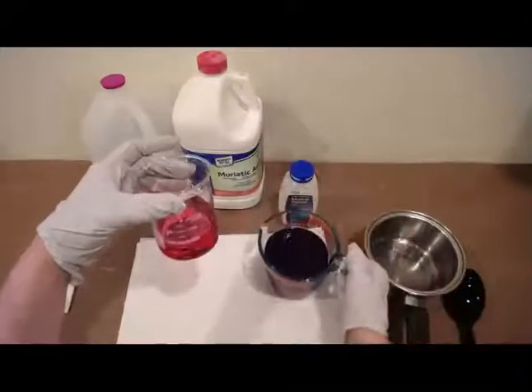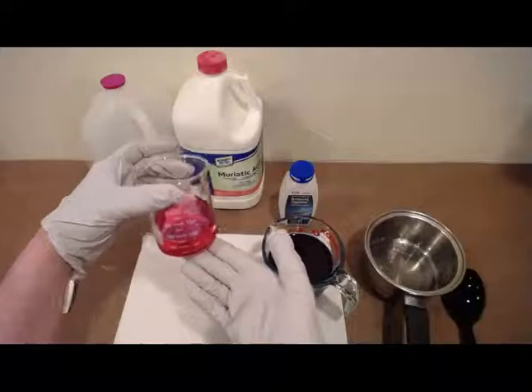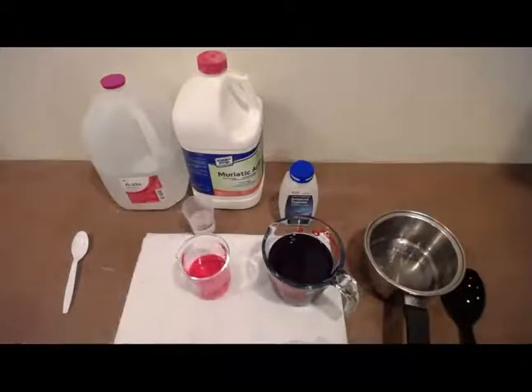And there we go. And hopefully you remember that this red cabbage pH indicator solution will turn pink in the presence of an acid. Okay, so there we have it. And it says in step 7, the color of the content should be pink or red. If not, the color of your toilet bowl cleaner is too strong and you need to try a different kind of toilet bowl cleaner. Now, the stronger the acid, the more red the indicator solution would turn. So that just gives you an idea of why it says pink or red.